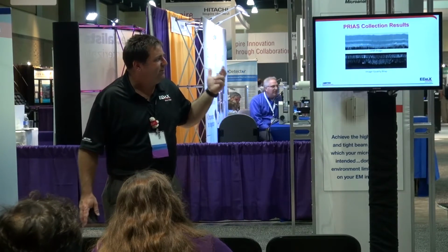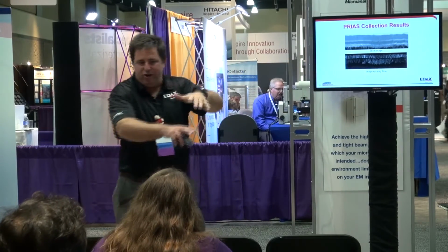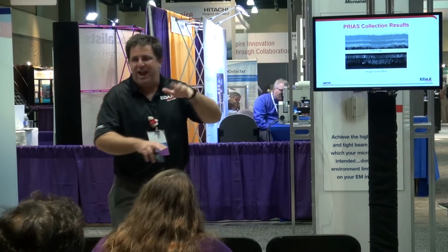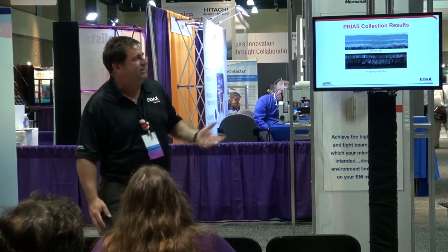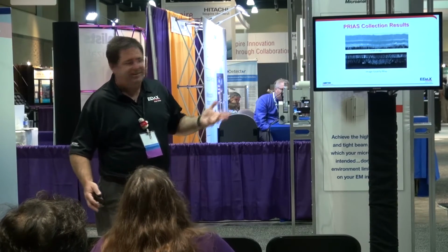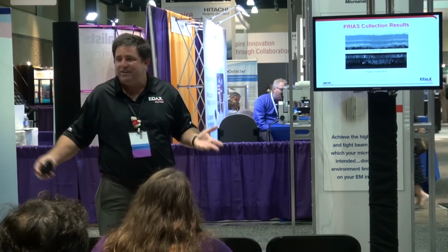And the question he had was, he said, I'm trying to find the interface layer. It's obviously a cross section. I'm trying to find these little interface layers. There's a multi-phase stack of materials. I'm not getting patterns everywhere, but I'm trying to resolve it. Have any ideas? And I said, well, did you try PRIAS? And his reaction was, well, what's that? I said, well, what version did you use? And he pulled it up and said, well, you're lucky, it's already in there. He didn't have to do anything to set it up.